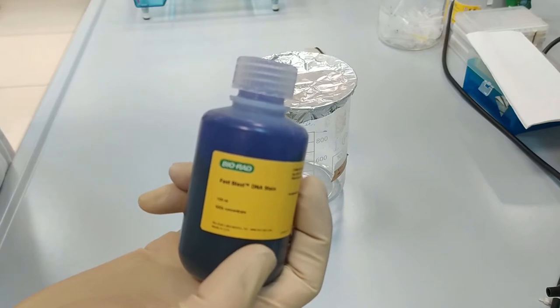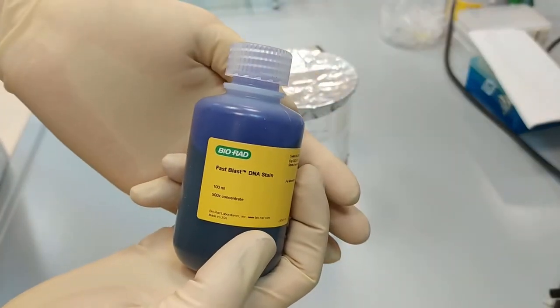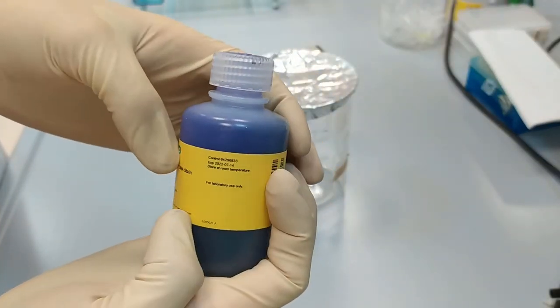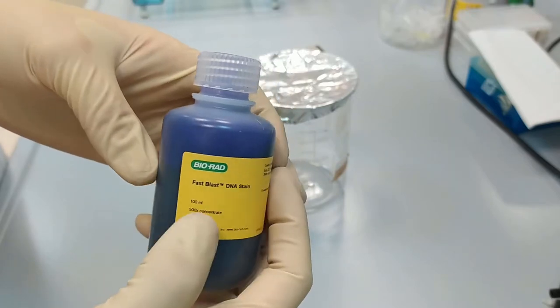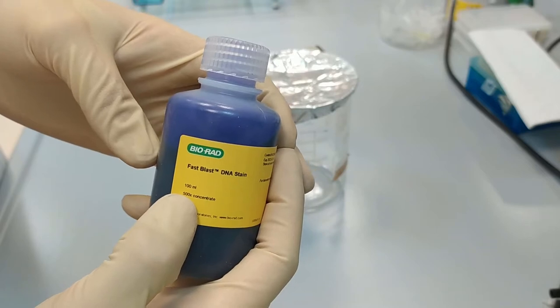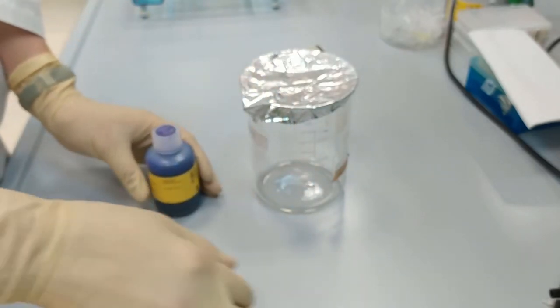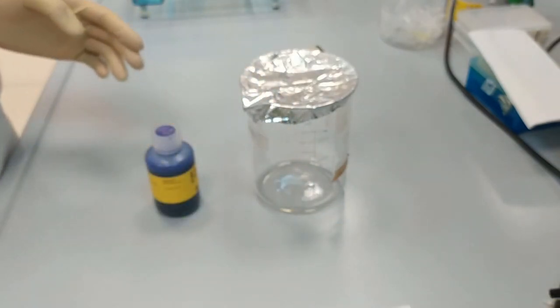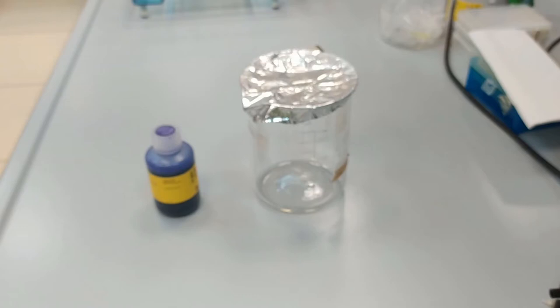So here you can see that it is 500x concentration and we are preparing 5x working solution. For that, we are taking 5 milliliters of the concentrate and add 495 milliliters of water.